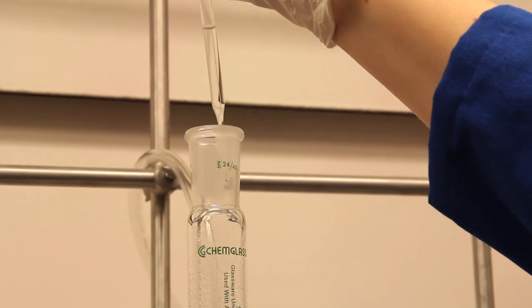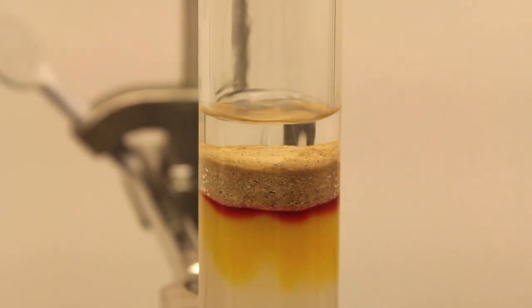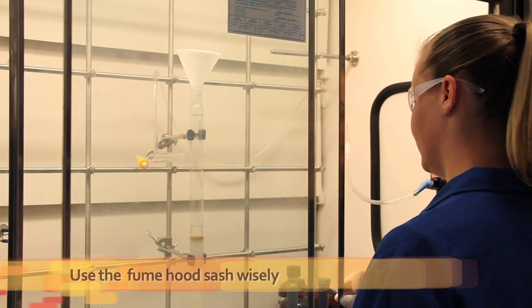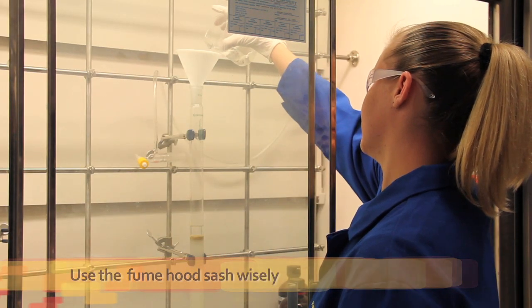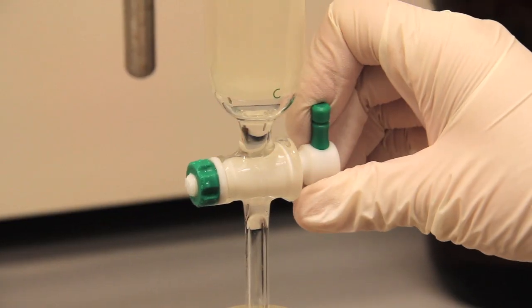That's a cool solution. Now I add a layer of solvent with a pipette since adding the solvent directly through a funnel will disturb the surface. After an inch of solvent is added, I can use the funnel. The safest way to run a column is to make sure the sash is between the column and you. It will best protect you in case of an explosion. Double check that you open the valve before applying air pressure. I read that a rate of 2 inches per minute gives you the best separation. Is that true?